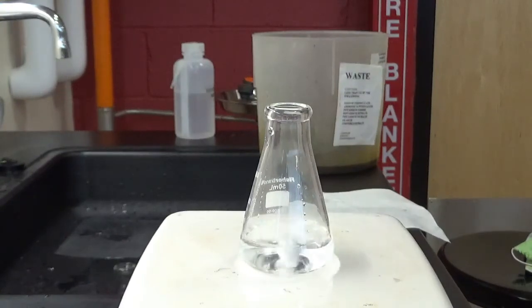Oh, it's way too long. Something's wrong. And then I think I made solution 4 wrong too. Oh, jeez. Okay. Did you put 2, 2, and 2 in this one? I think I did. I think I put 4 and 10 in mine. I know I put 4.